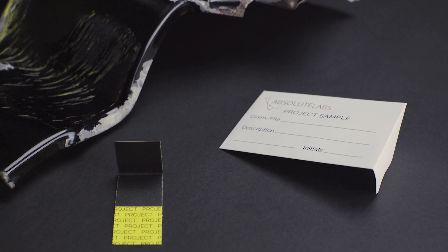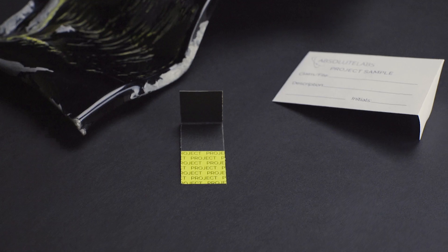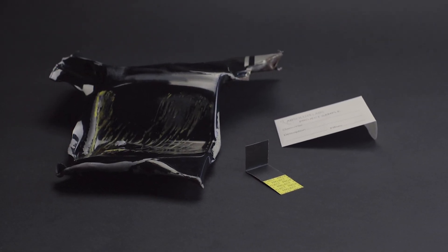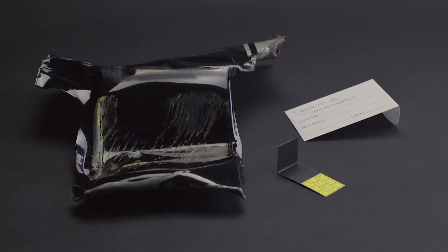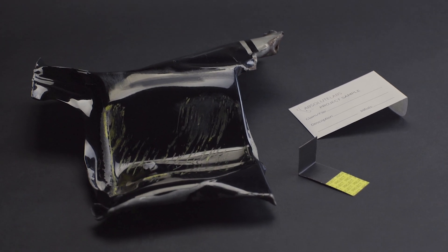Project samples can be used to distinguish between automotive coatings and non-automotive materials such as latex paint, oil-based paint, epoxy, concrete, and polymers.